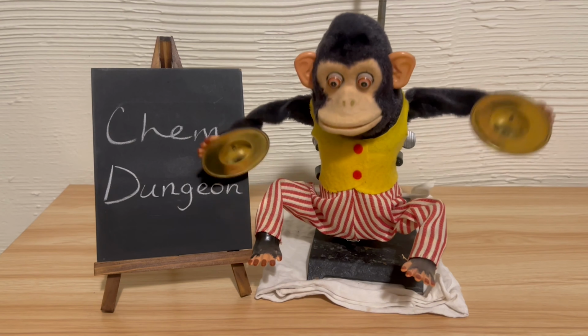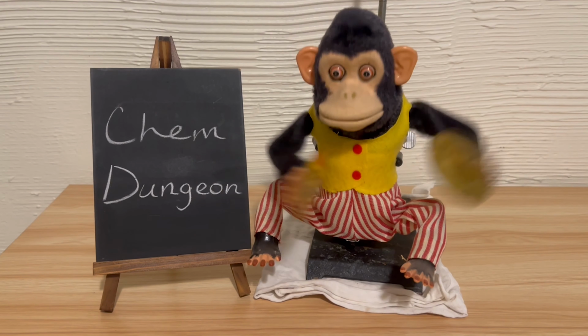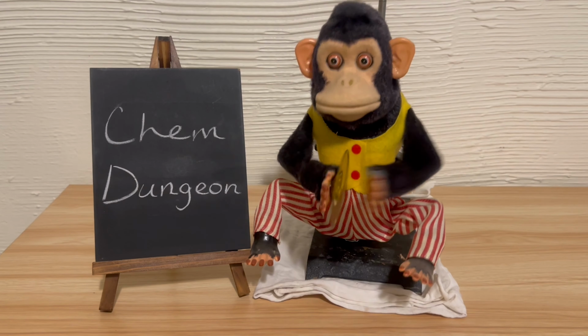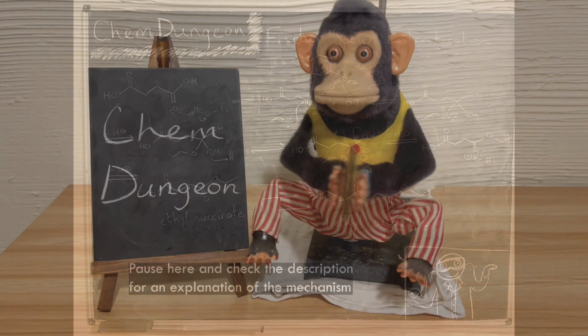When the Dean-Stark trap fills, I'll empty it into a 100 milliliter round bottom flask filled with a bunch of potassium carbonate to dry it, and once the RBF is full, it requires about 3 traps full worth, I'll filter the dried ethanol toluene mixture through cotton, then return it to the reaction flask through the condenser. I'll continue doing this until the liquid collecting in the trap stops being cloudy, then do it twice more for good measure, and then cut the heat and move on to the workup.